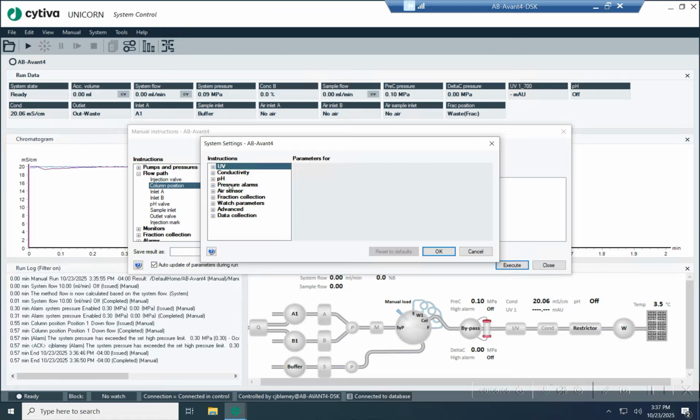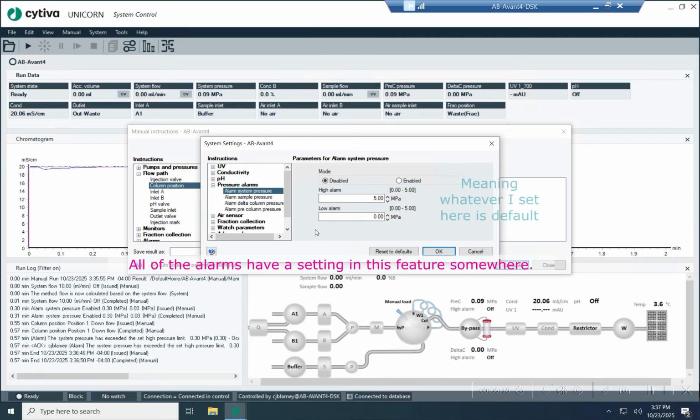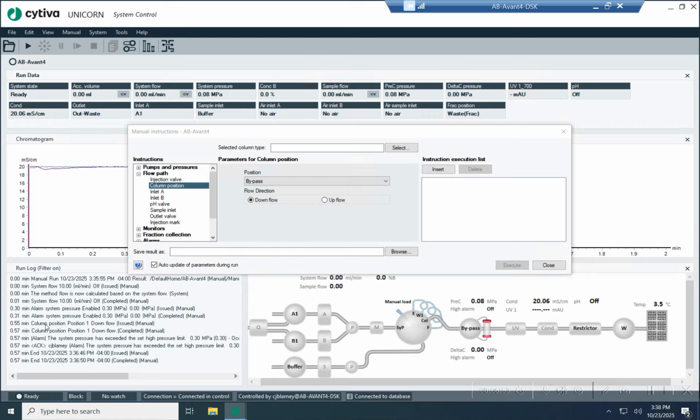So here we'll just play with the pressure alarm. So here's the pressure alarm and here's system pressure. Basically, this is the default pressure for the system anytime you turn it on. If I change this to 0.30, okay. So now the pressure is 0.3, and I don't need to actually issue the alarm instruction.